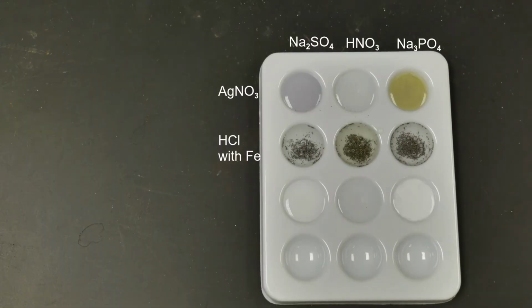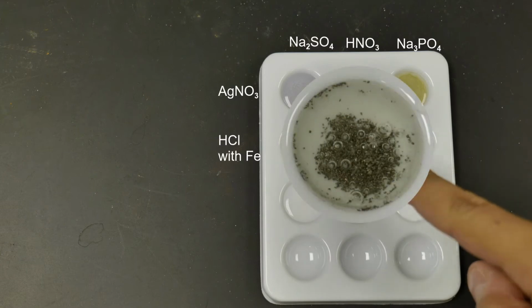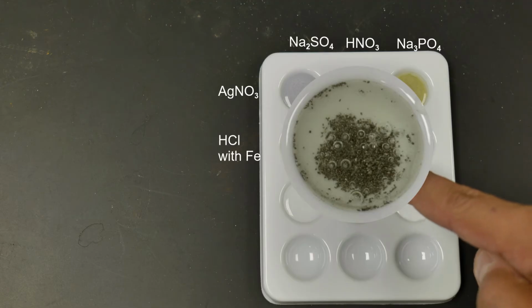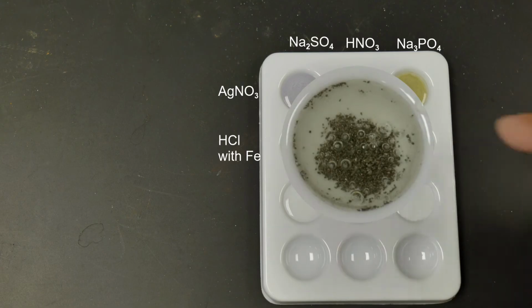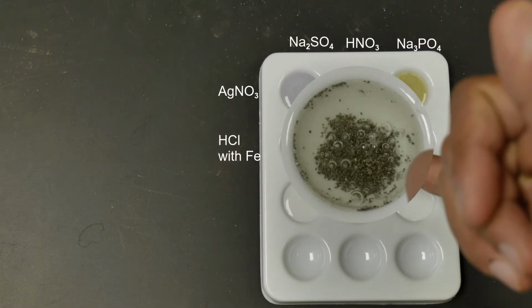All right, so it has been a little bit of time here, and I really want to take a look at this one here in the middle with the iron, hydrochloric acid, and nitric acid. Now, at the beginning of these reactions, there really wasn't much going on. But after they've sat for a while, I do actually see that there has been a little bit of change. So the coloring here for this one in the middle is a bit yellow looking.